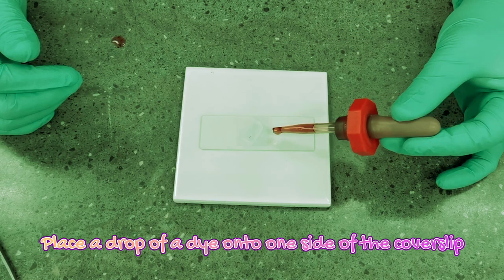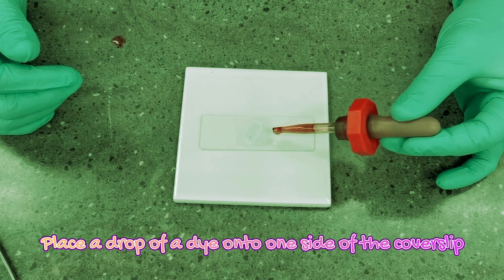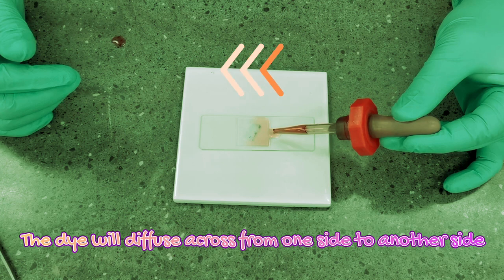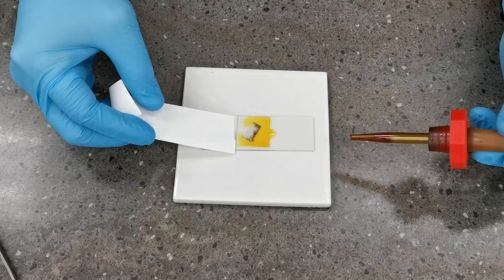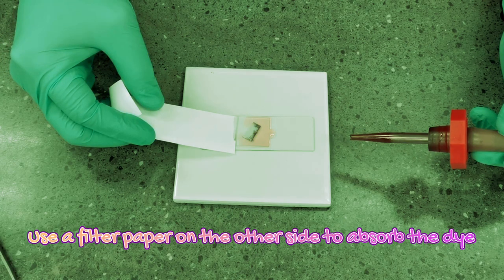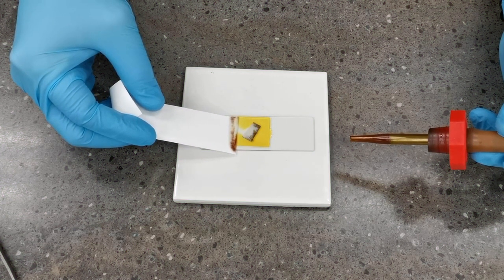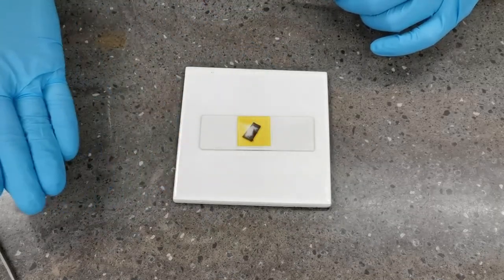You will then add a drop of a dye like iodine onto one side of the cover slip. This dye will diffuse into the area under the cover slip. You will need to use a filter paper on the other side of the cover slip to help draw the dye across. Doing this will produce a nice and neat staining of the cells before viewing under the microscope.